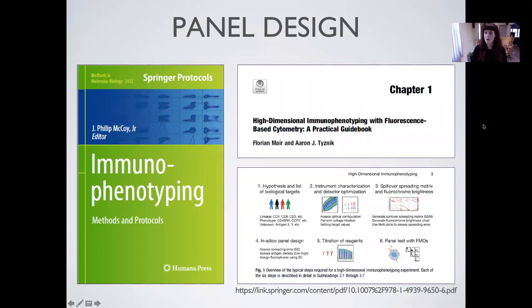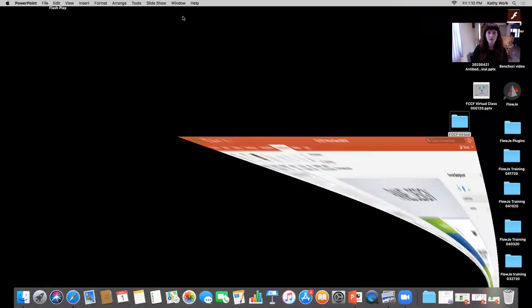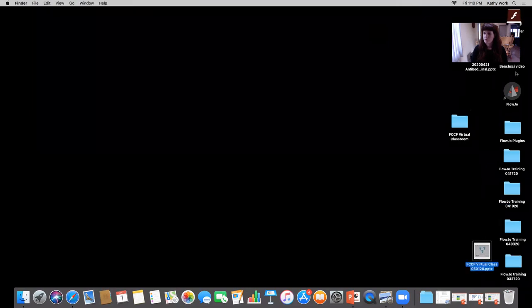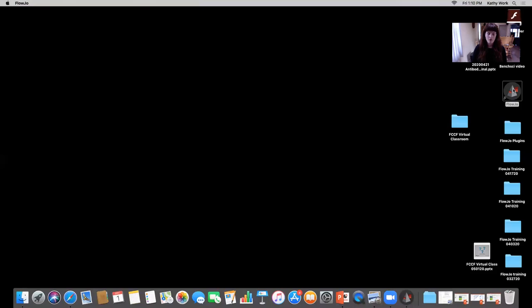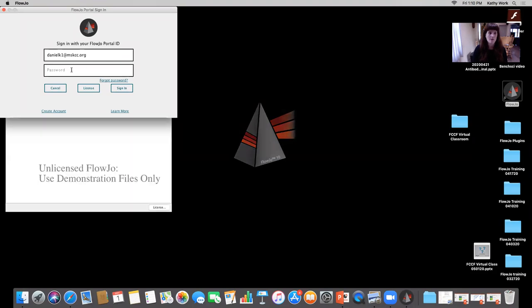Okay, with that, even though I have one or two more slides I'll reference later, I will get going in the actual software. Okay. So I'm gonna go ahead and open up the FlowJo software and we'll get started with our first data set. For anyone that's very, very new to FlowJo, what I would highly encourage you to do is to go ahead and check out our website where we have the recordings of these previous sessions.